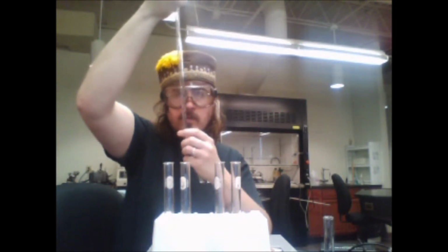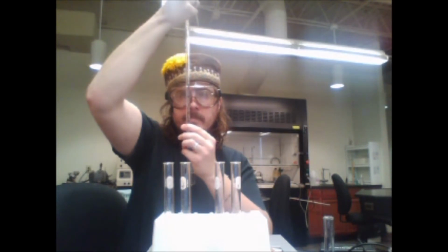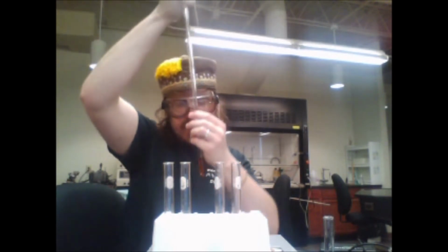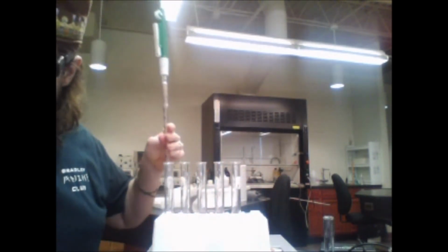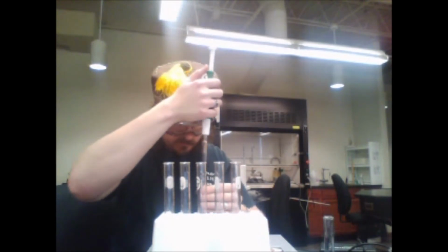Once again, we're going from what we get. That one I added 3.1 mL.